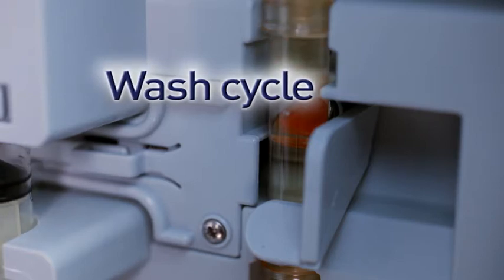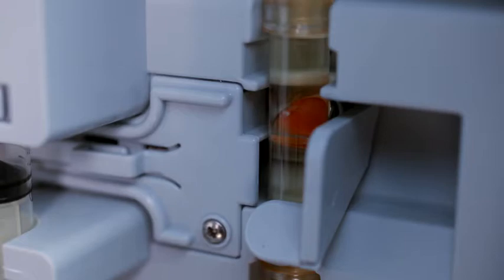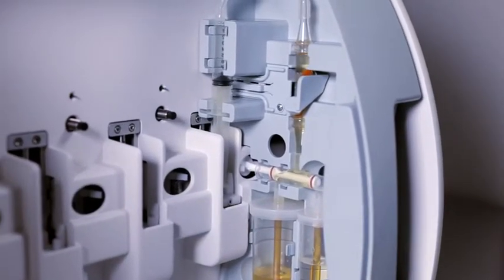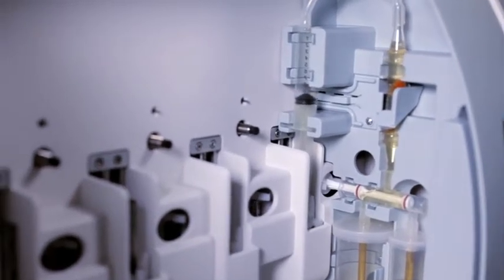During the wash cycle, the beads will be rinsed with a sterile PBS buffer multiple times. When the cycle is complete, the magnets move to the open position and disengage from the capture chamber. You will hear a single click.